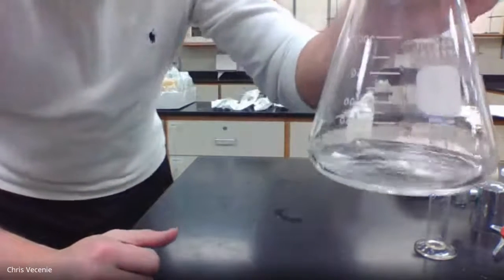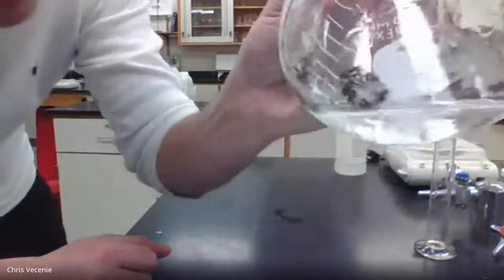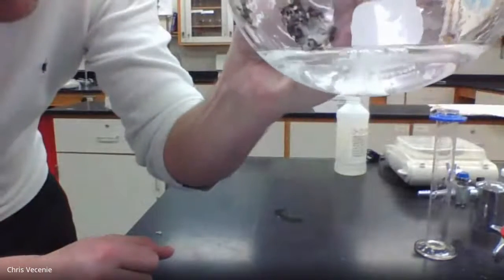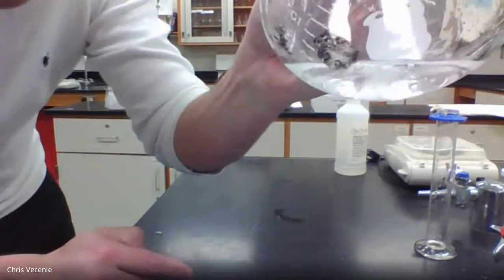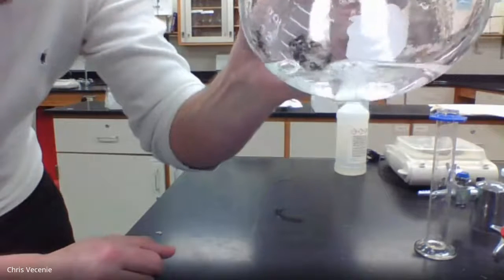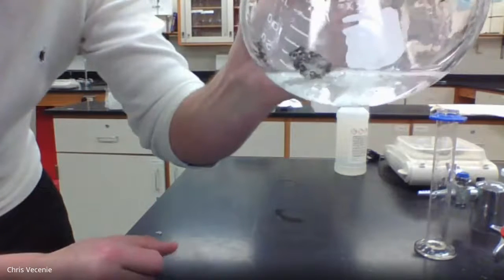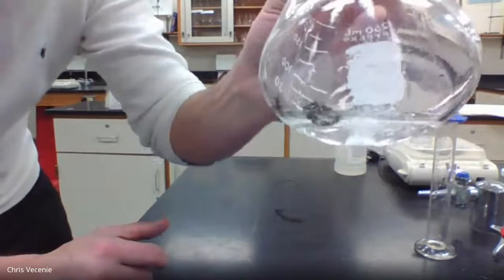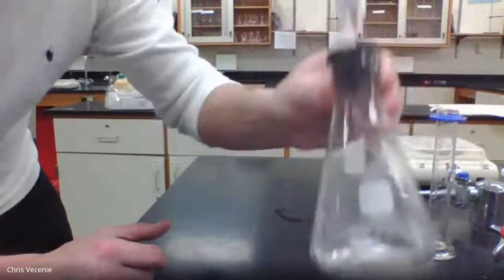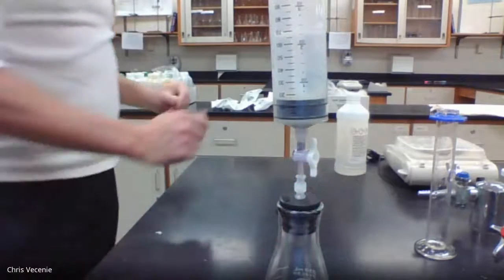You guys can see that we've got some fizzing action here in the bottom. That's the acid reacting with the calcium carbonate. We're making the calcium chloride, and those ions are just dissolving and staying in the liquid there. We're creating the hydrogen carbonate, which is decomposing into the water and the CO2 gas. And the CO2 gas is what we're going to try to catch.